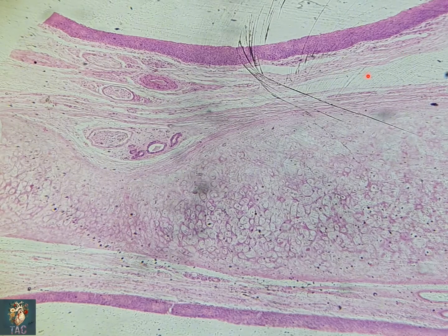Beneath the epithelium you can see the submucosa, which is moderately dense connective tissue and contains some nerve fibers, some blood vessels, and a small amount of gland. The core of the epiglottis is formed by the elastic cartilage. This slide is taken at lower magnification, and for identification you can see in the core the elastic cartilage, in which the cartilage cells, the chondrocytes, are present along with the elastic fibers.